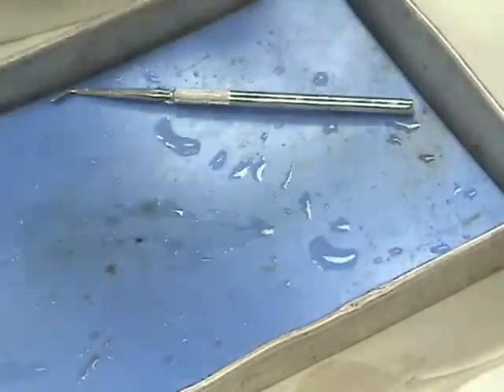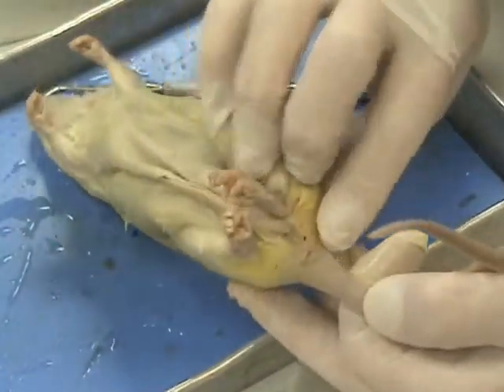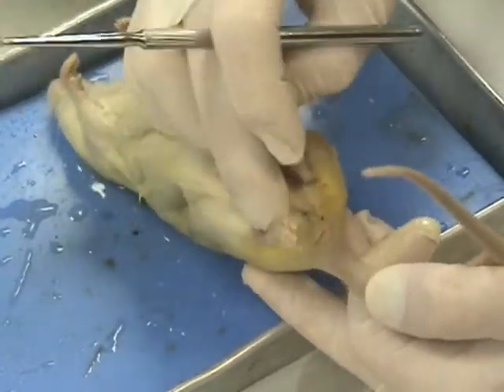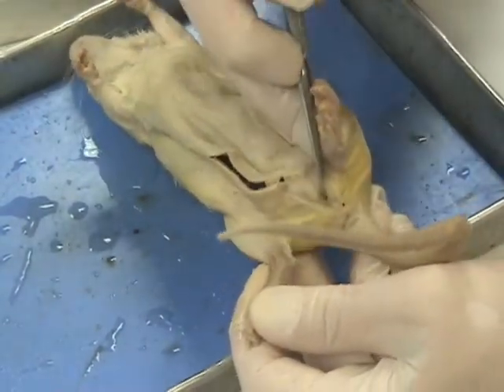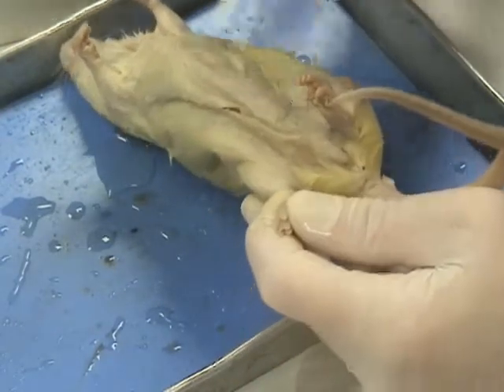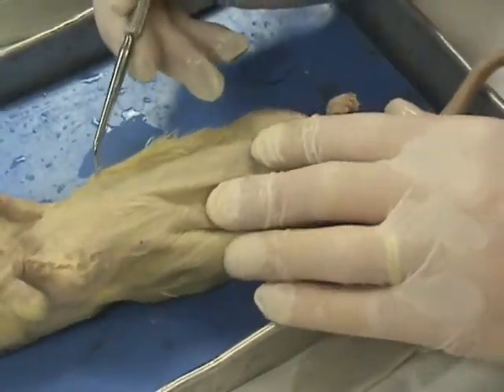For that female rat, again, the anus, and then anterior to the anus we have an opening here, and that opening, if I separate these feet out a little bit for you, this opening is called the vagina. The vagina has the urethra on the anterior end of the vagina, and in addition, we were asked today to figure out how many nipples the rat has.